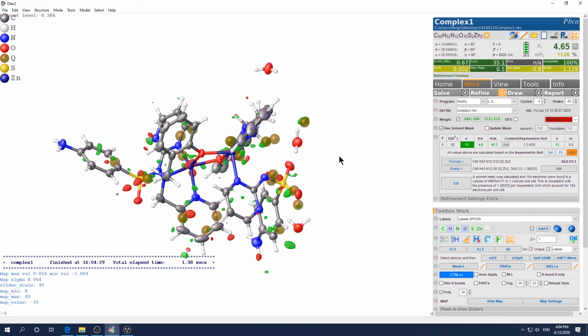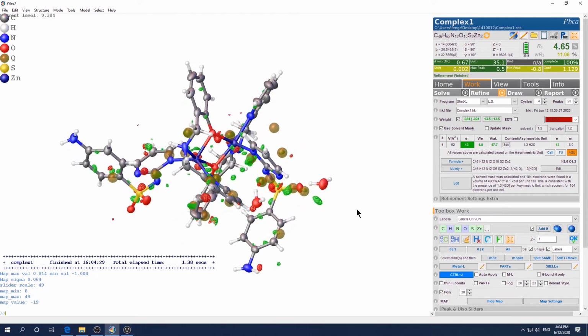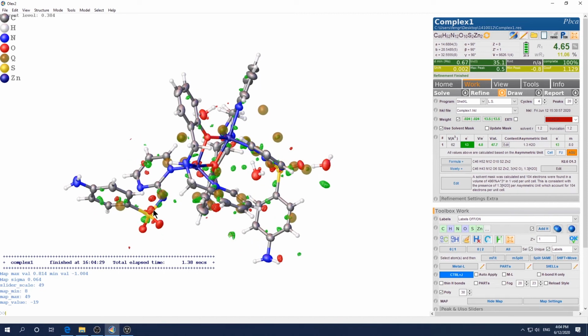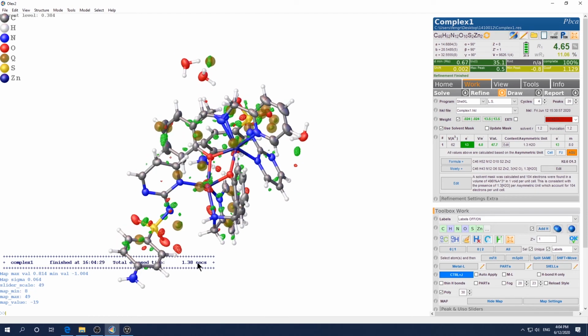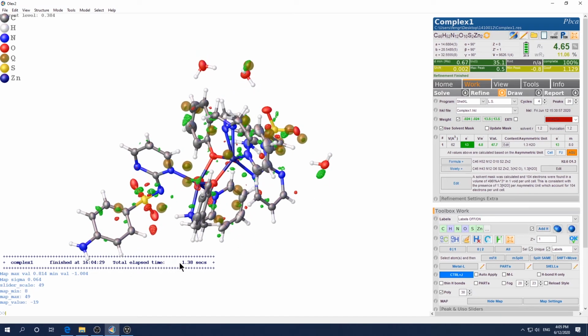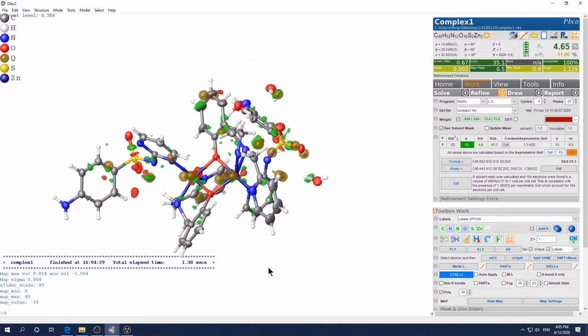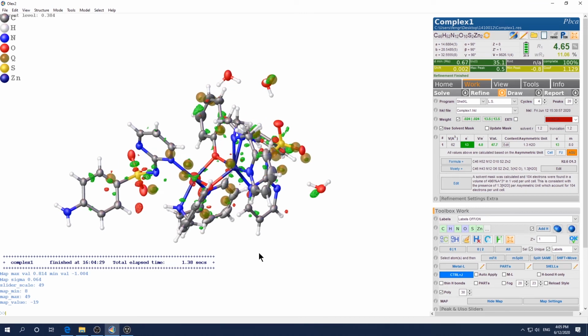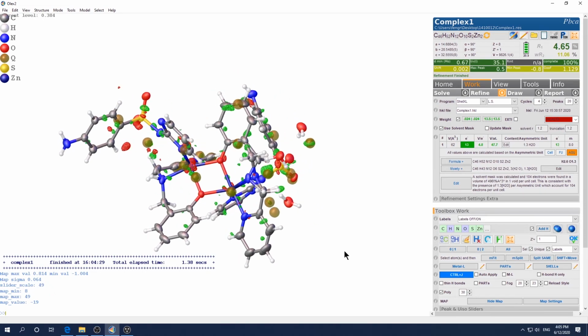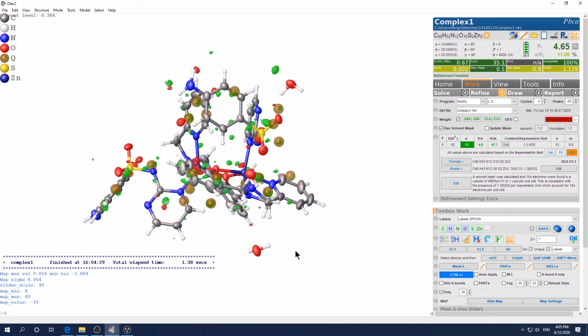Yeah, so for the Q peaks near the heavy atoms, these are perfectly normal. And for the positive density and electron holes near the heavy atoms, they are also perfectly normal because they are actually the consequence of the termination errors and absorption errors. So if you only find Q peaks near heavy atoms or electron density holes near heavy atoms, and you know for sure based on the chemistry knowledge that the atom type is correct, then you can let it go, just as long as that Q peak is not too big. Okay, so far looks pretty good to me.